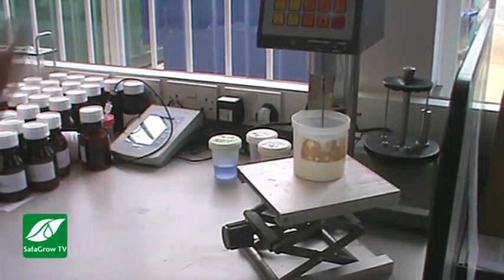Right, so it's friction against the viscosity? It's drag. So it's almost like torque in a way, as an engine would have. It's a complicated piece of maths, but this is at 0 and that's at the speed you set, and you can determine the viscosity because of that. Okay, that's good.